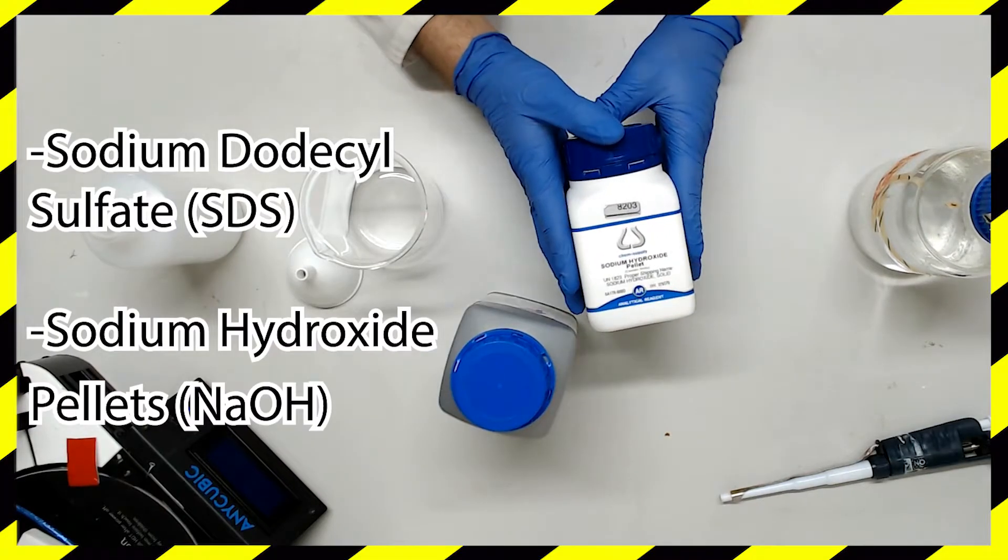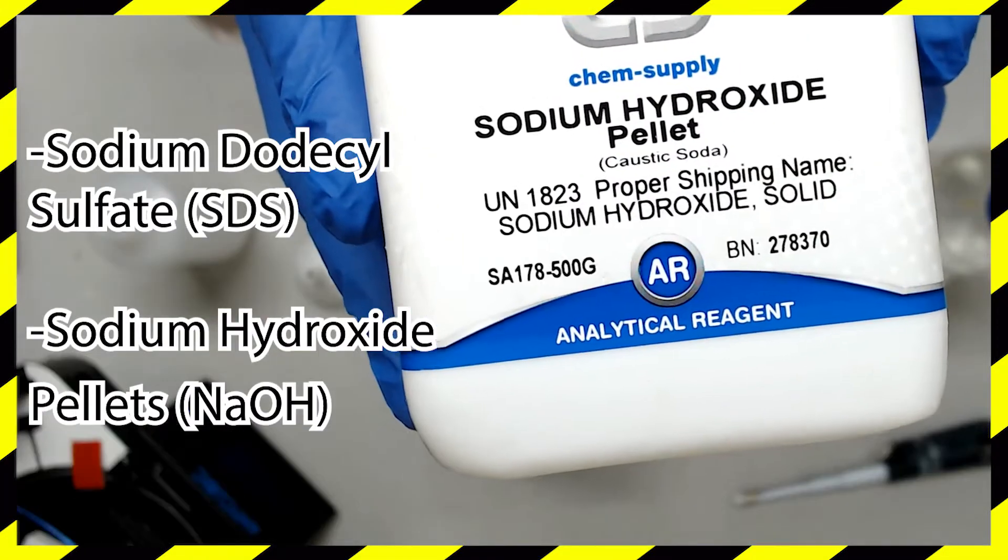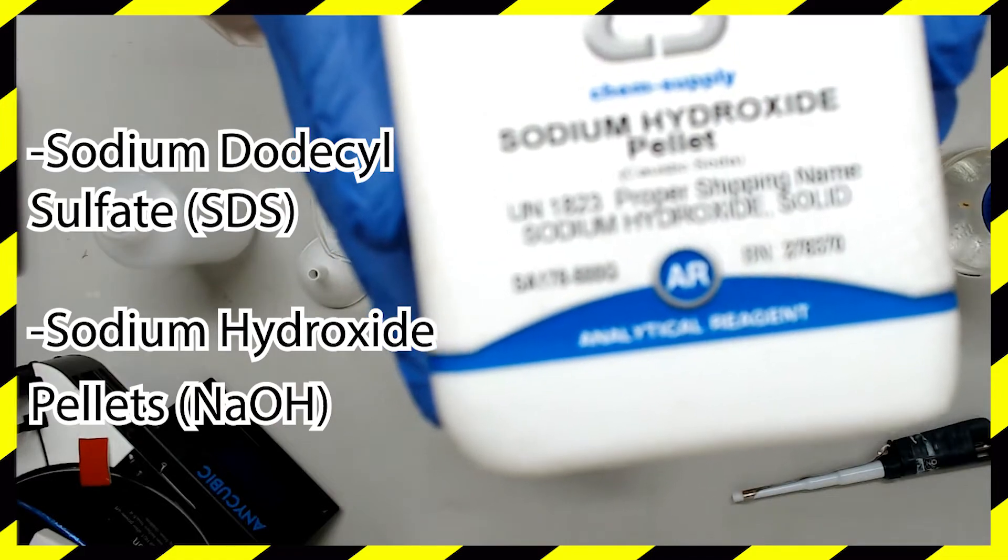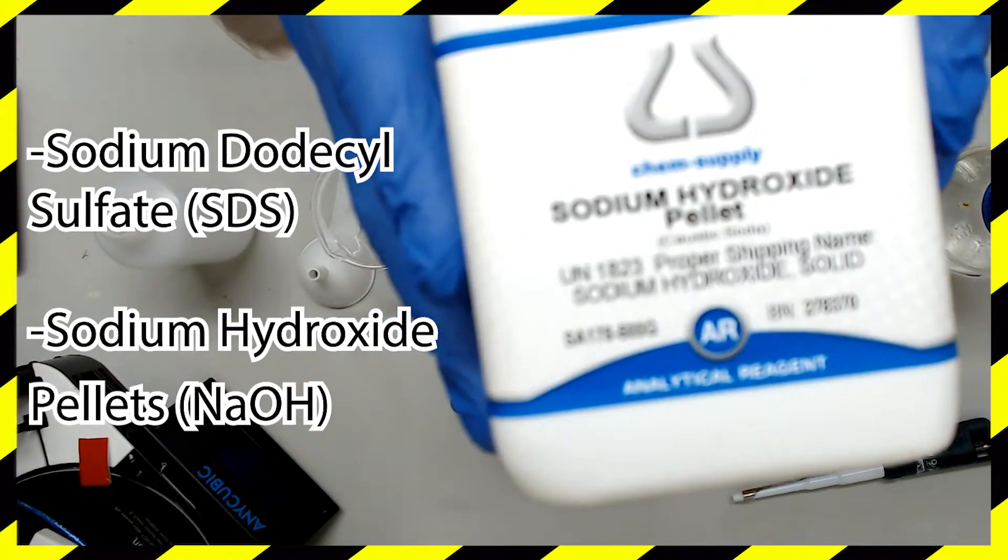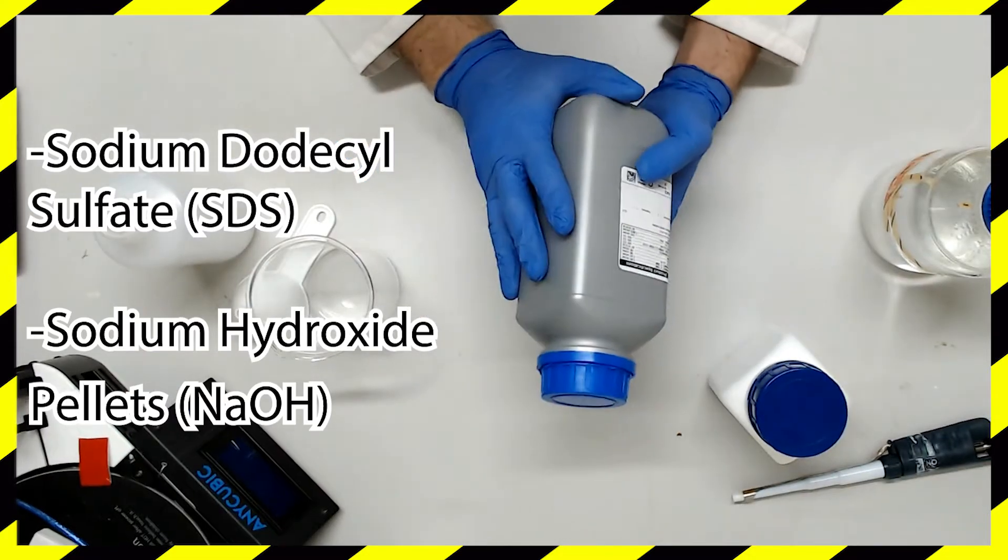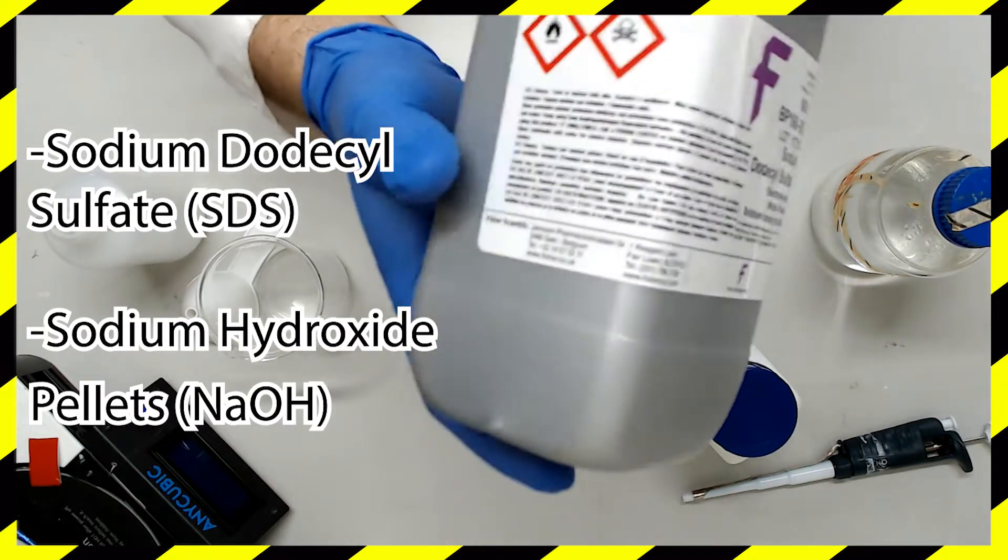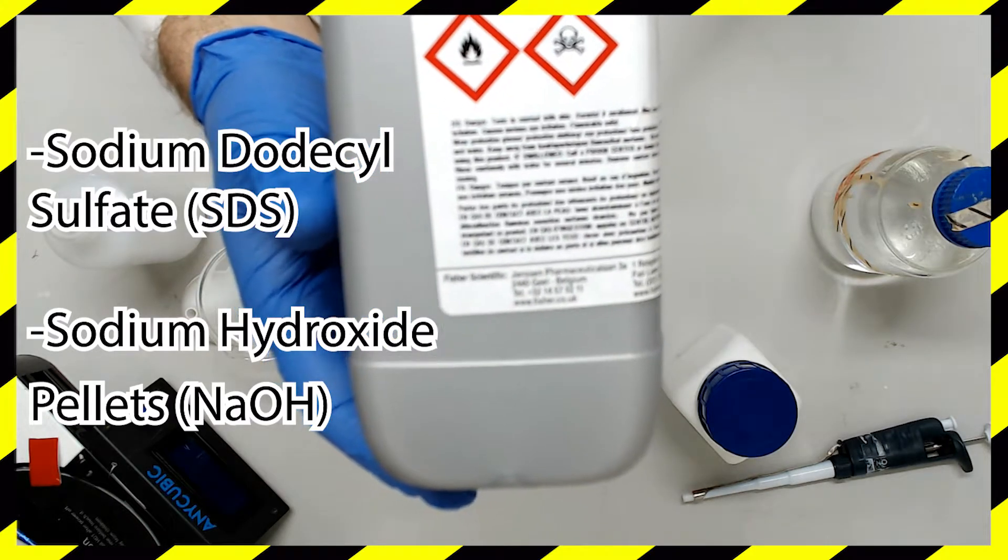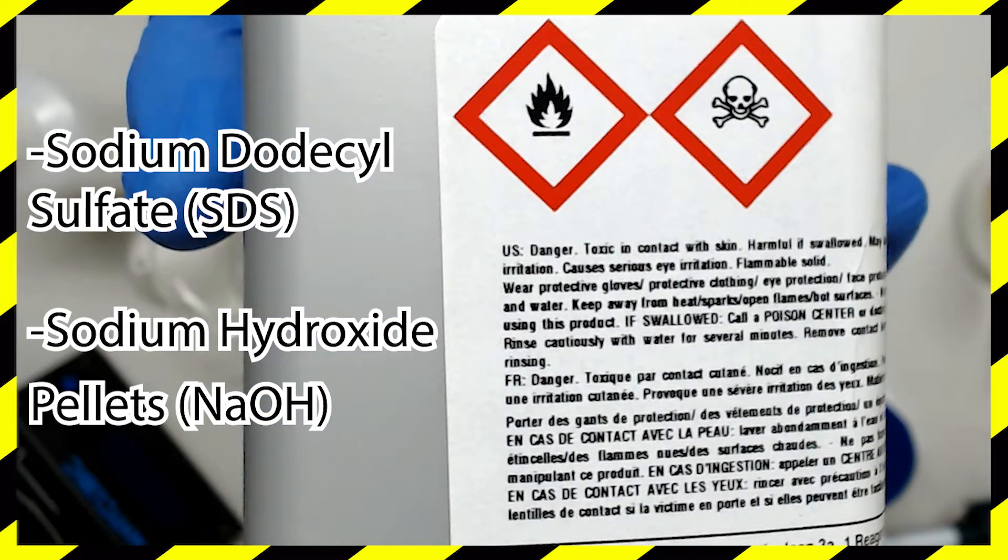The components of this buffer are difficult to order based on relative deadliness. They're both really awful if they land on your skin or get in your eyes. If you're diluting from a solution, remember that concentrated sodium hydroxide is very corrosive and releases some hefty fumes. Gloves, lab coat and goggles are a must, and ensure you move to a well ventilated area such as a chemical hood to carry out the dilution. As with powerful acids, you must add this extremely basic solution to water and not the other way around.